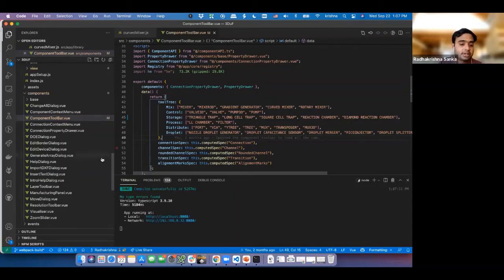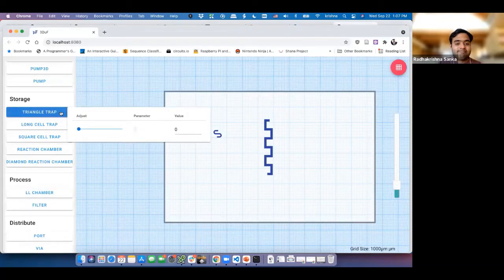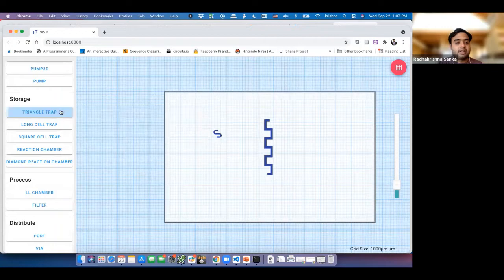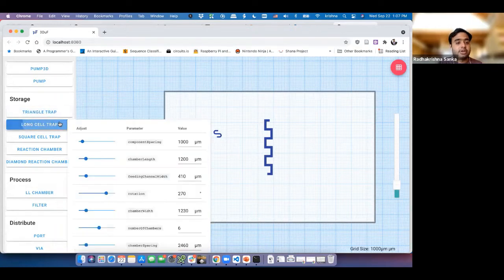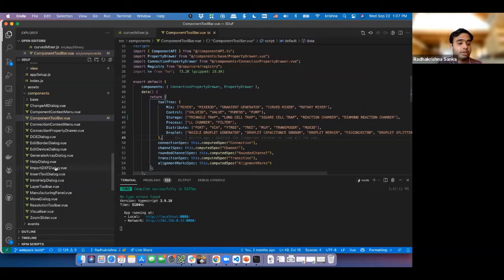The second thing I need to do is, if I open this right now, you'll see the button. But when you click on it, it doesn't know what this is. There's a slider over here, but it's not anything, because over here, it knows what it is. So the second thing we need to do is let it understand what the definition of triangle trap is.